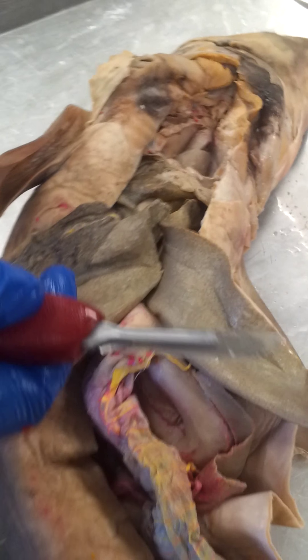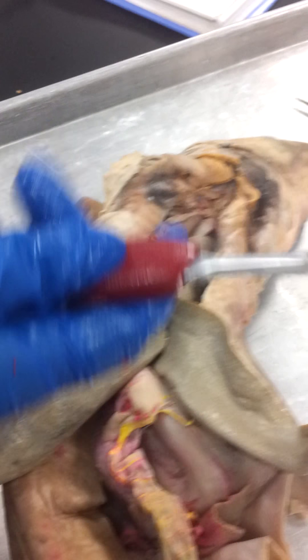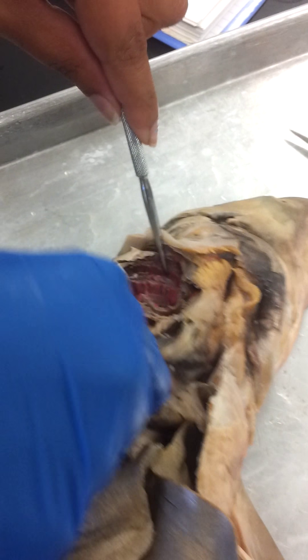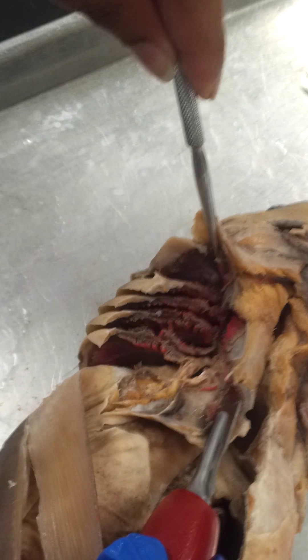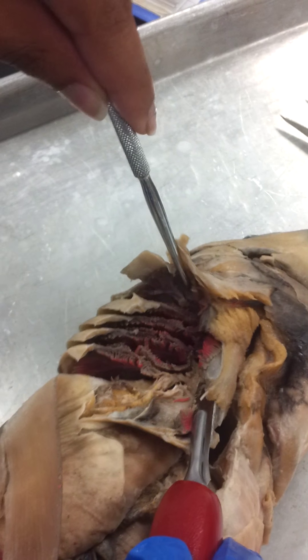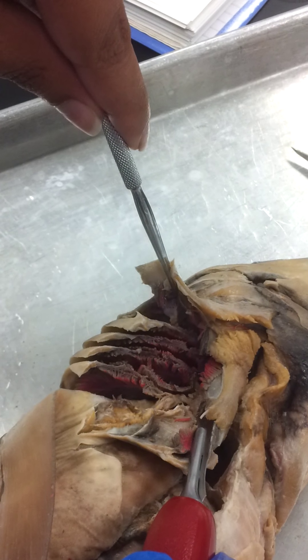Next we're going to look at the afferent and efferent branchial arteries, which can be found in the gills. These are your gill slits. The afferent branchial arteries receive deoxygenated blood, and once the blood goes through the gills it gets oxygenated and exits through the efferent branchial arteries.